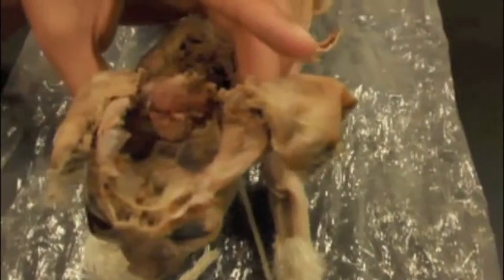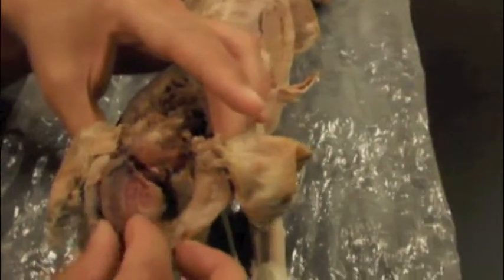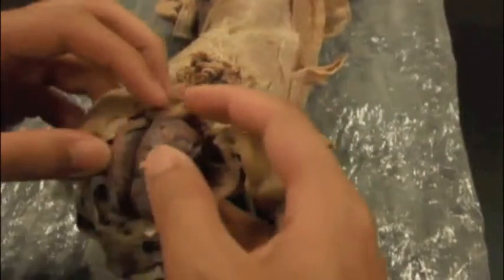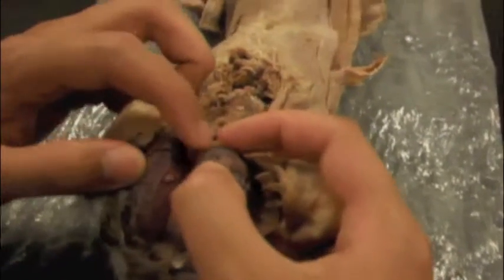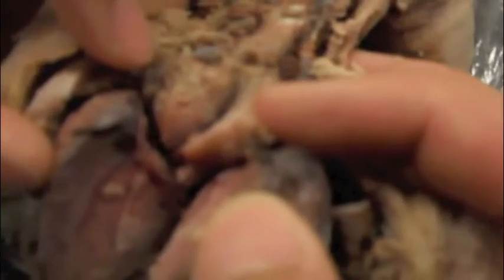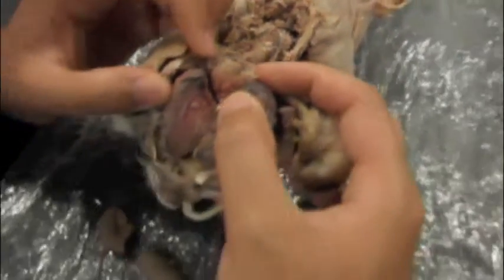Alright, so here we have 2 cortexes of the brain. As you can see, the right one is going to be inserted into the brain right about now. Oh, there we go. Yeah, that's the right hemisphere. And now there's the left hemisphere. And right underneath this is the medulla oblongata. And you can see the tree of life right there. You see a bunch of white strands coming out. That's the tree of life. And there we have it. That is our brain.